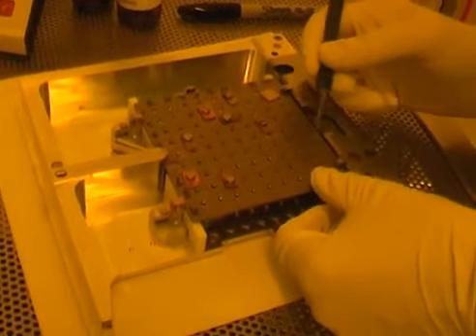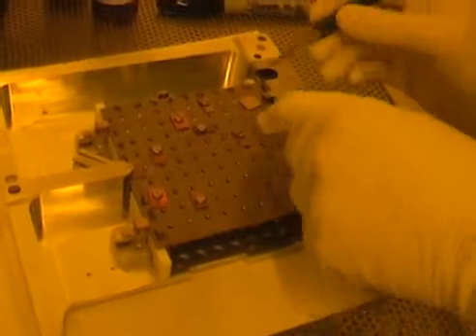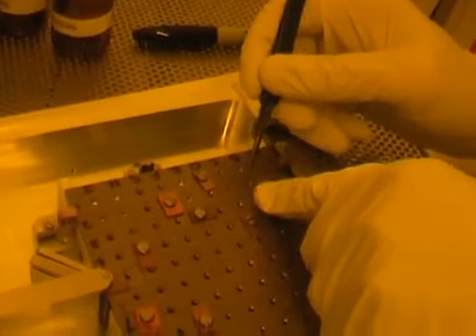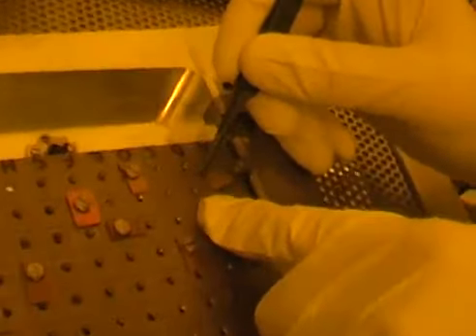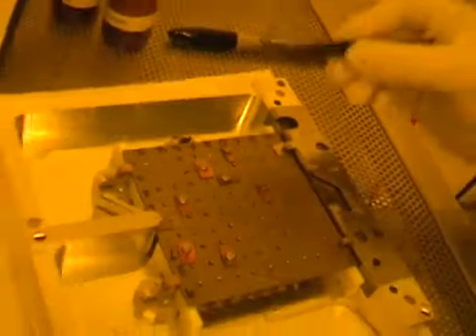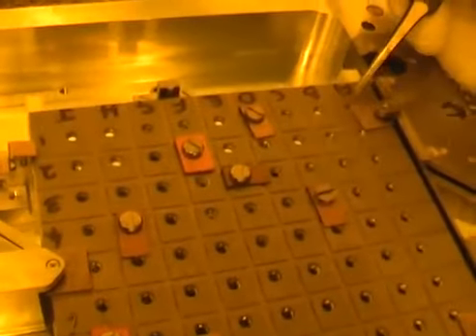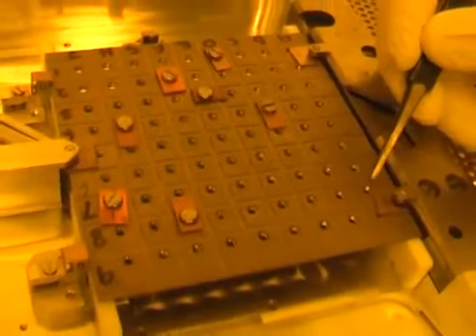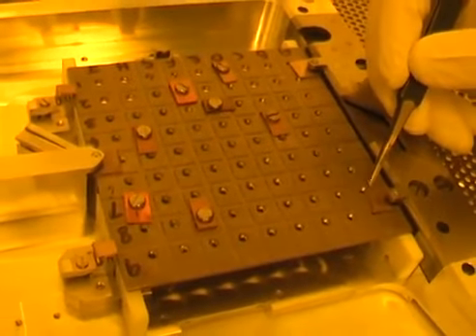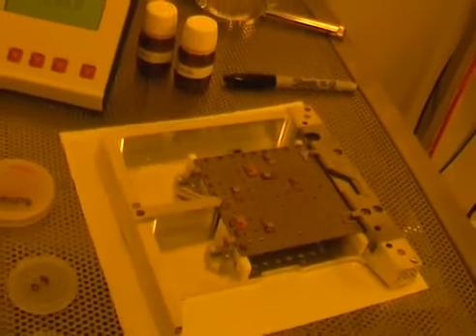You need to carefully put them under the height sapphires here. There's springs under the plate which push it up, and it's held in 3 positions which will keep it nice and planar. It's important that I check that these are not going to fall out, so I give them a little sideways push. If they did fall out and land somewhere in the machine, it could cause damage, so clearly it's important to double check there.